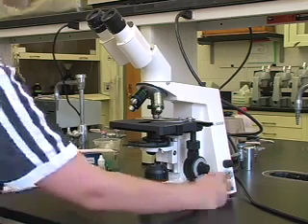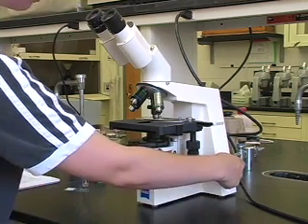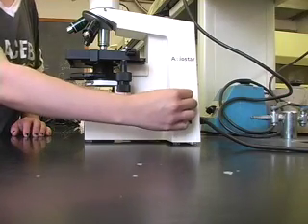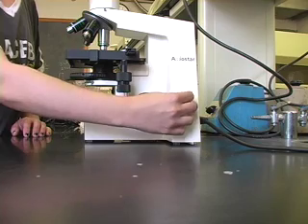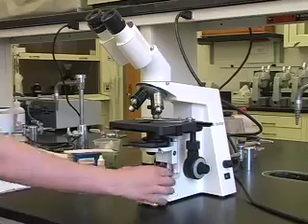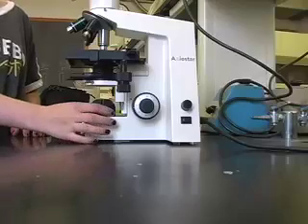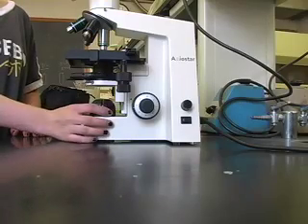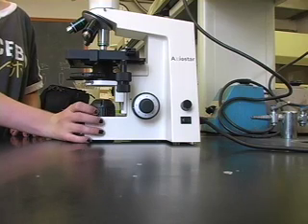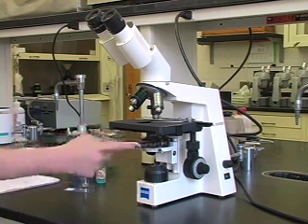To focus a microscope using the Köhler technique, first turn the microscope on using the switch in the back of the scope. Set the brightness to low using the knob right above the on-off switch. The lamp is at the bottom of the microscope. The ridged collar around it controls the lamp iris, which determines the diameter of the light beam. Turn the collar clockwise to open the lamp iris. Turn the aperture selector to H for brightfield microscopy.